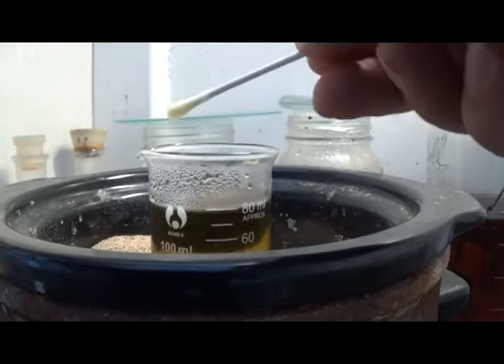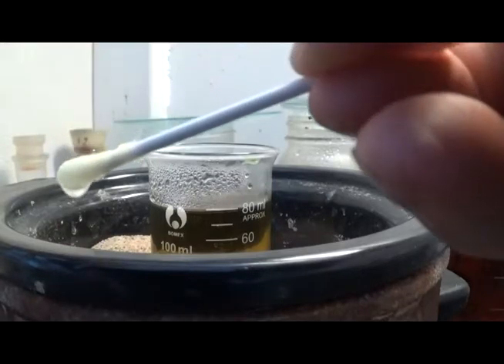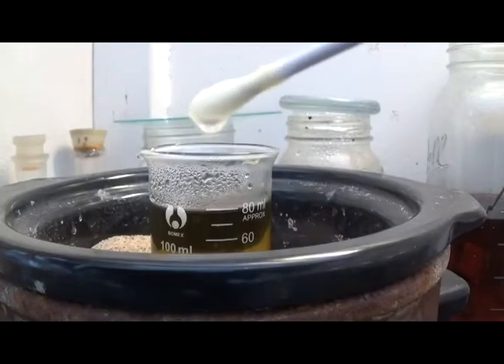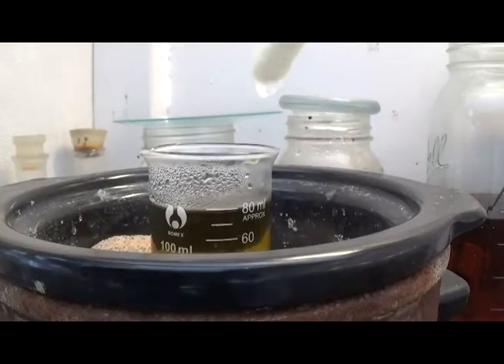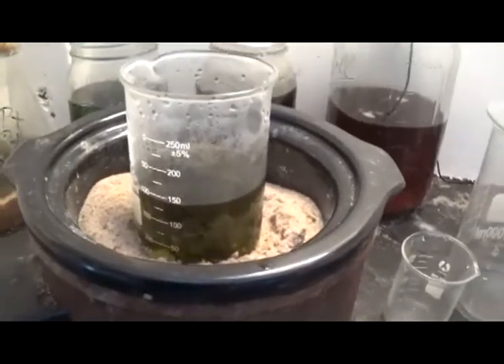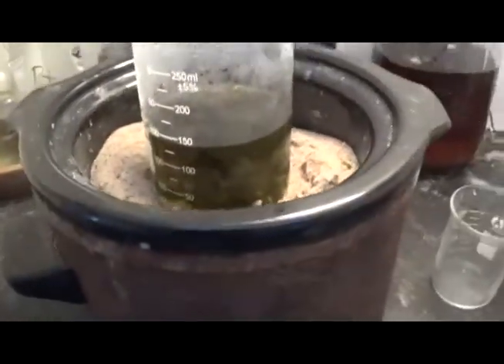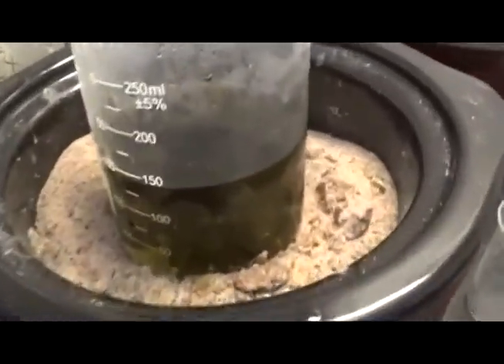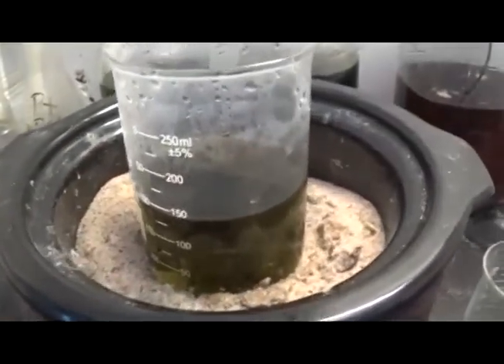Let's see if we made a big boo-boo here. We look negative — that's good news. No gold in solution. We added it to a 250 ml beaker, added about another 125 ml of our presumably weak copper chloride, and another 3 ml of hydrogen peroxide. We have the desired amber color back — that kind of scared me. But I'm thinking it's iron — we have some metal parts. Or that was brass dissolving — copper and zinc.